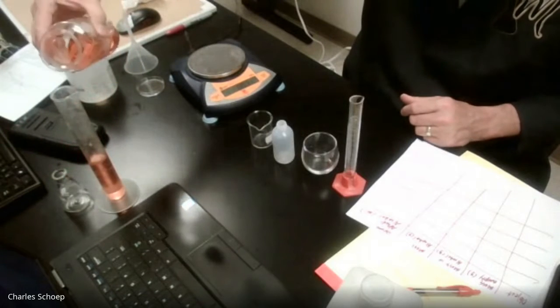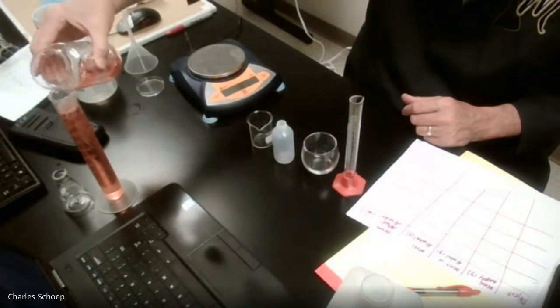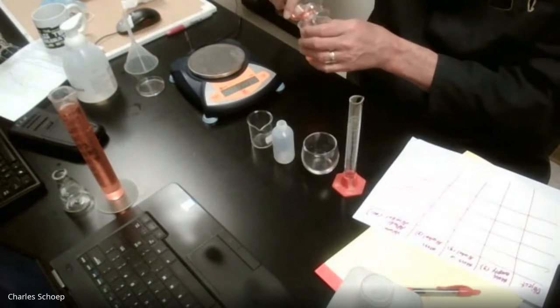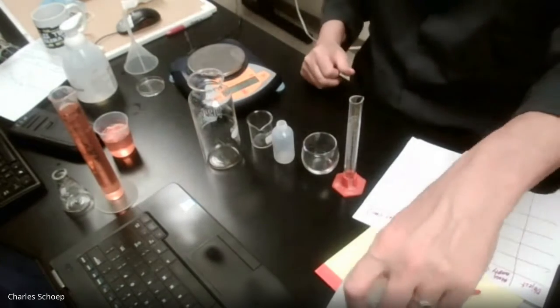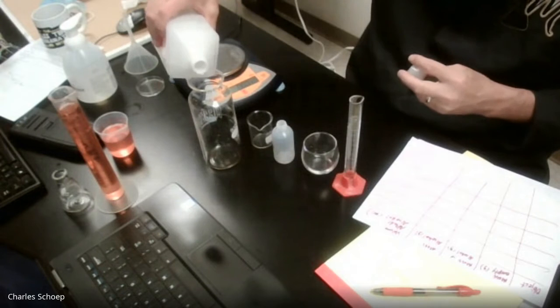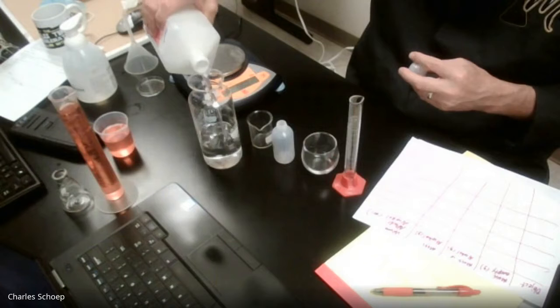So let's have this go away. I need another place to put this so it's empty. I should have thought this one through better. All right, go there, because I want to be able to pour this stuff back in there. So we're just going to get plenty of alcohol to do the thing.